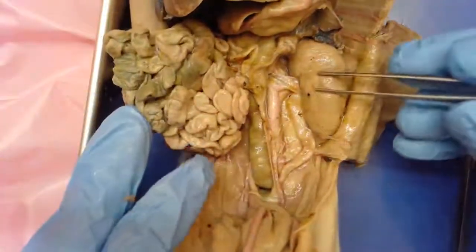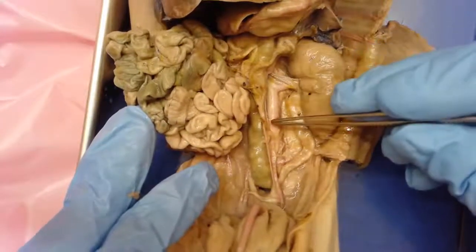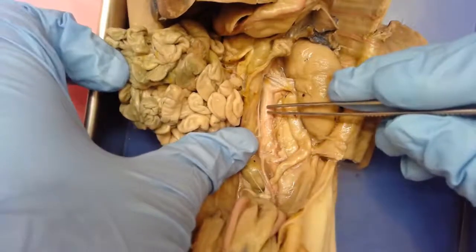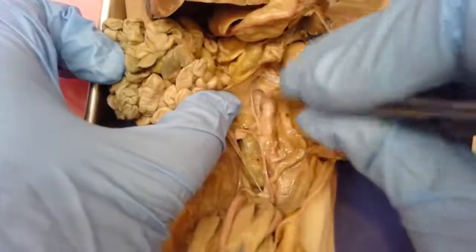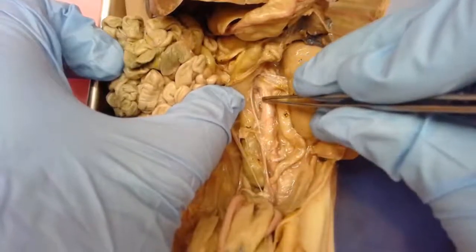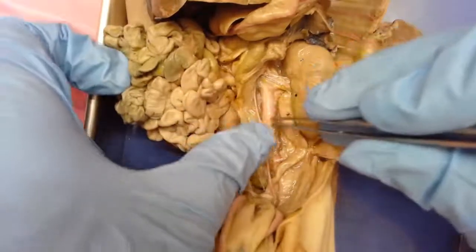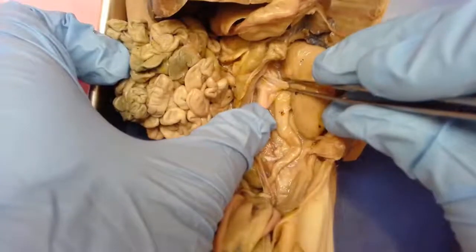Going back to the one that's already cleaned up, you can see blood vessels leading into the kidney. This large blood vessel here is the descending aorta — the branch from the heart that came down to the lower part of the body. Just behind it, kind of hard to see, is the vena cava — the posterior vena cava that was carrying blood back to the heart — running alongside.